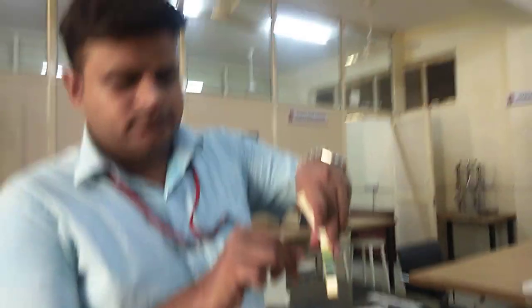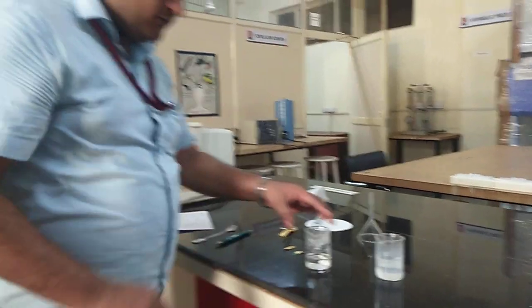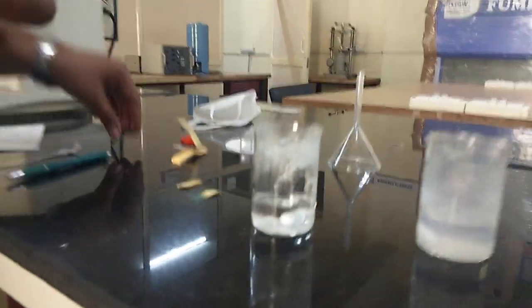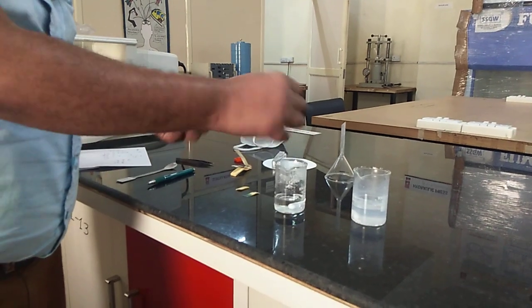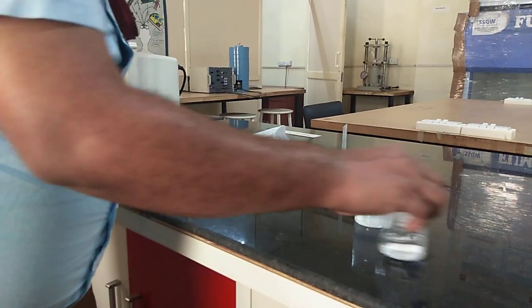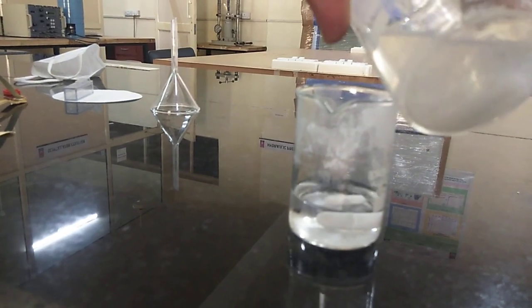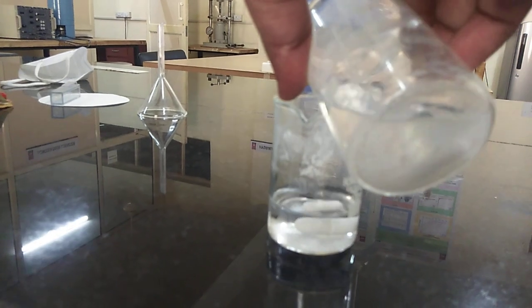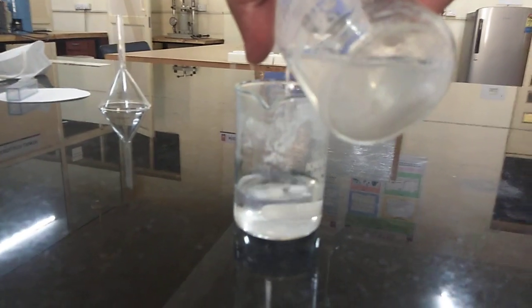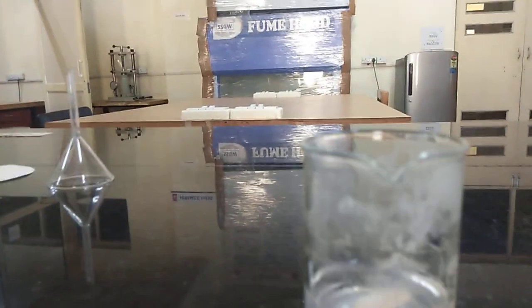We will keep adding a few drops of NaOH solution into the zinc acetate solution. Once added, you will see fog-like precipitation start forming. The clear acidic solution will become milky as the basic solution is added. I am now adding one drop, two drops — you can see white precipitates appearing and the solution becoming milky.